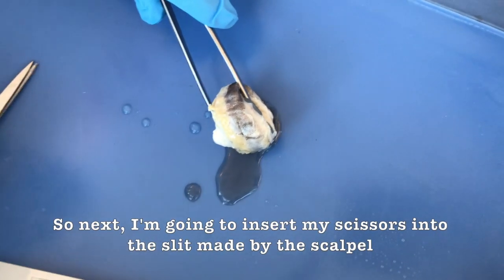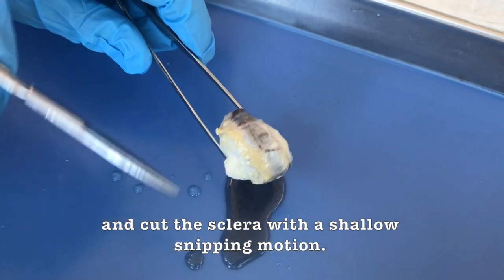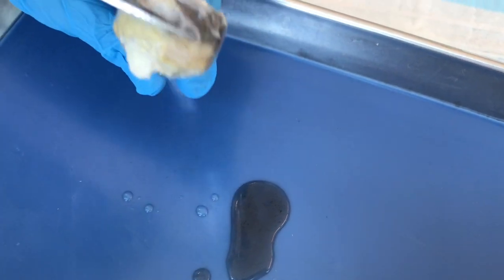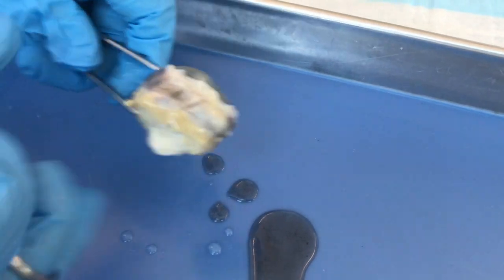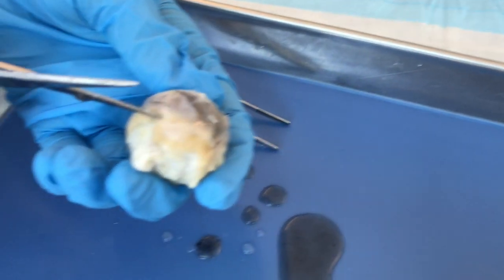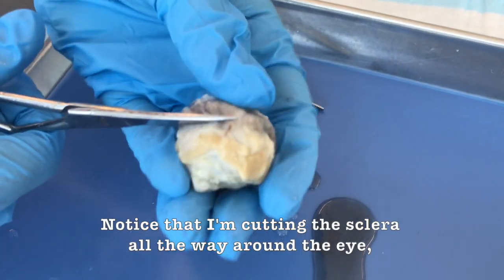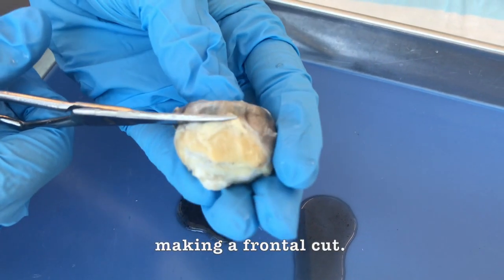So next, I'm going to insert my scissors into the slit made by the scalpel and cut the sclera with a shallow snipping motion. Notice that I am cutting the sclera all the way around the eye, making a frontal cut.